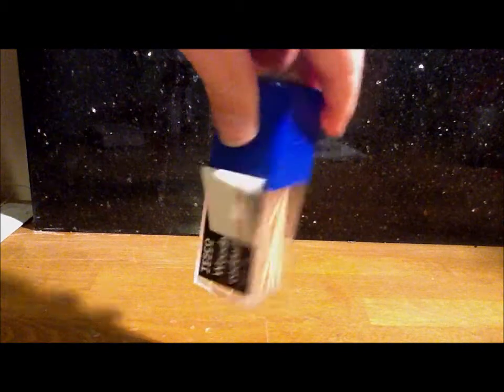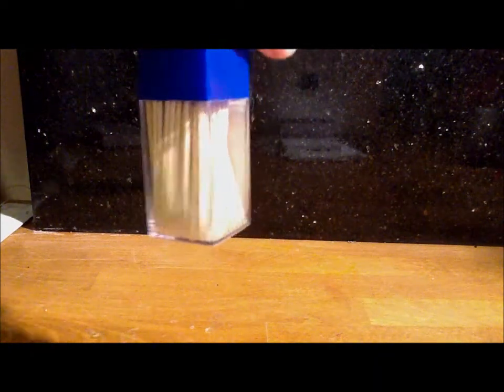Matches and splints, I'm using cocktail sticks. The glassware you will need is a conical flask and, well it's not really glassware but a little plastic cap to put on the conical flask.